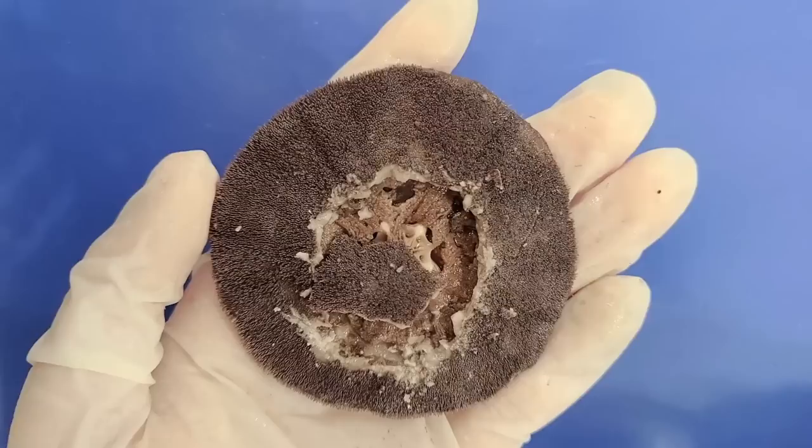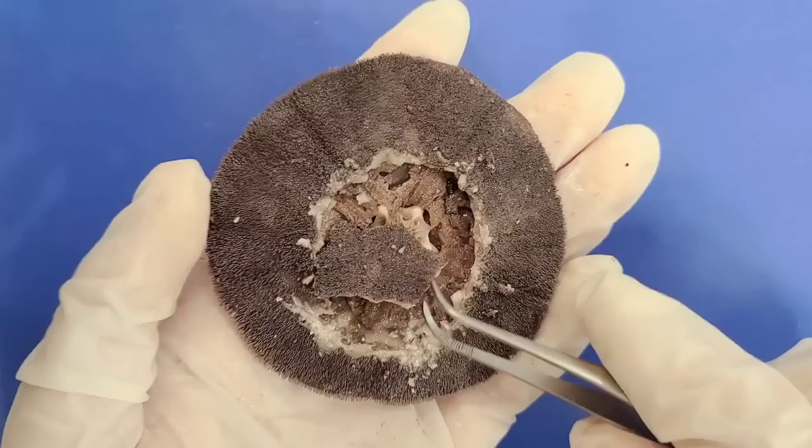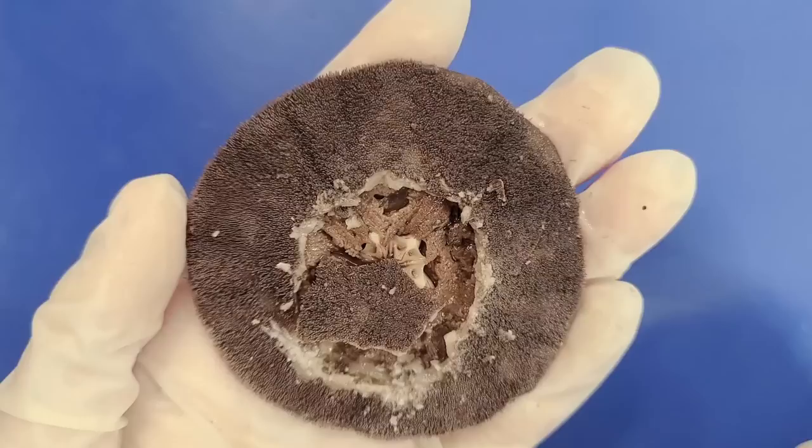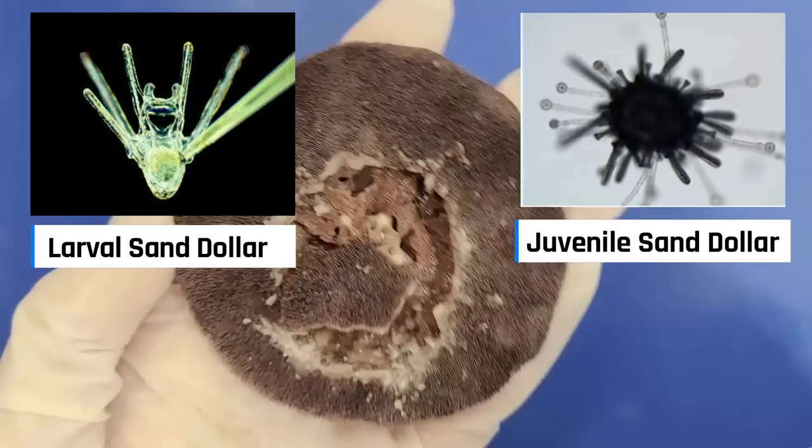These gonads produce sperm or eggs depending on whether the sand dollar is male or female. There's no real way to tell the sex of a sand dollar by observation, so this one could be either male or female. Fertilization happens externally in sand dollars, and sand dollars usually live in colonies, meaning they live very closely together and synchronize their spawning, which greatly increases the chances of fertilization. After the egg is fertilized, the sand dollar goes through a number of larval and juvenile stages which look very different from this adult shape.